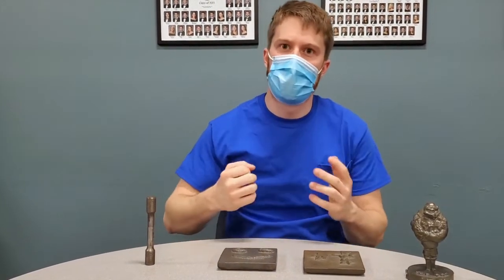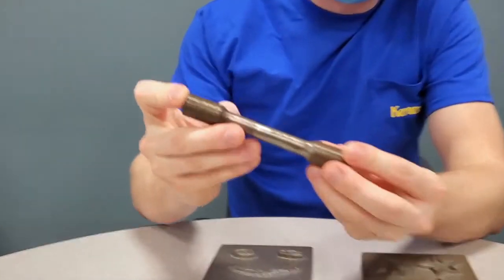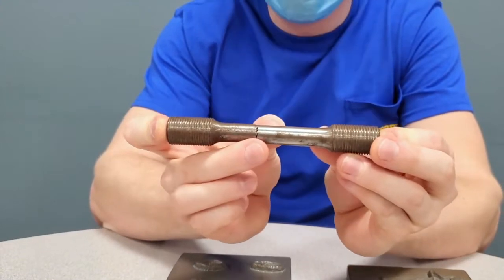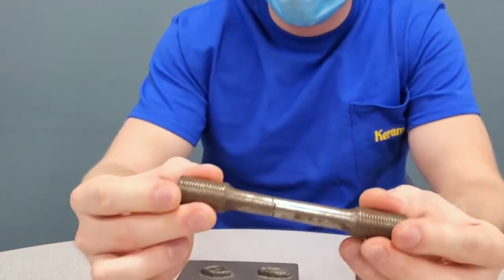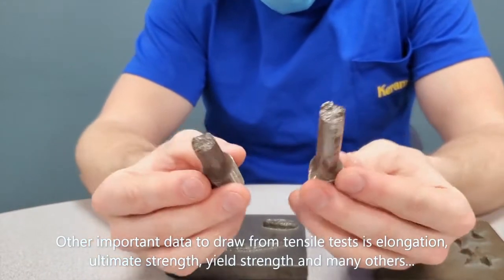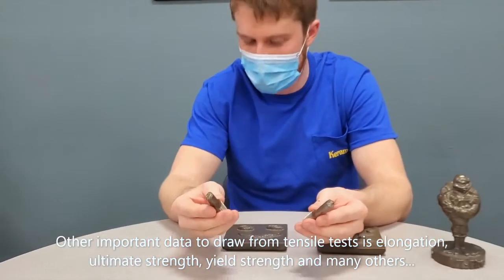The last cool metal thing I have here, something we do a lot as materials engineers, is we look at failure: how materials behave when they're put under different forces, and how and why they fail. One of the most classic examples is just tensile testing. We take this bar and machine it so the middle is thinner than the outside pieces, which are where it's held. That ensures that it will fail somewhere in this thinner area. We then pull on it until it eventually snaps, and then we can look at the surface of how it broke and understand things about the microstructure of the metal and how it behaves under force.